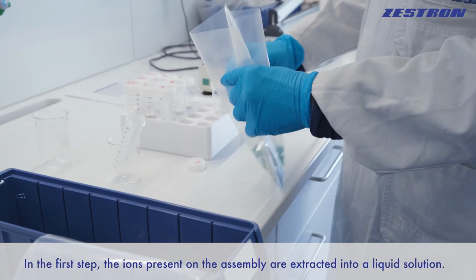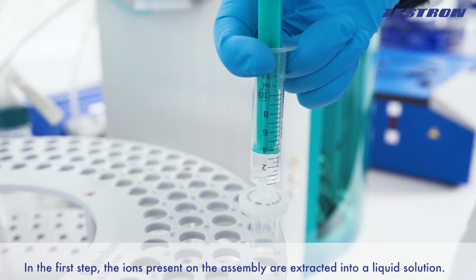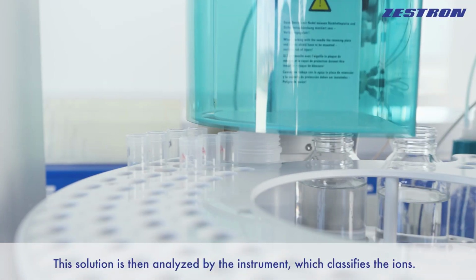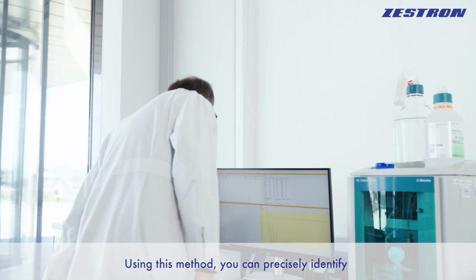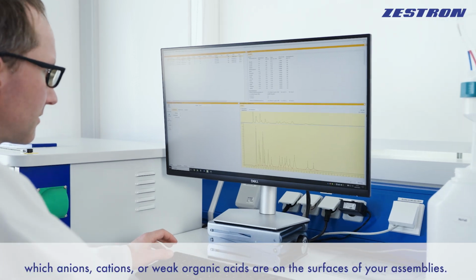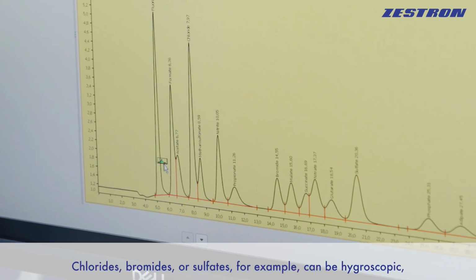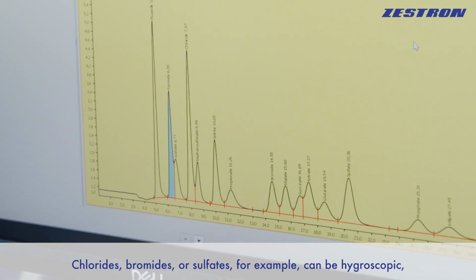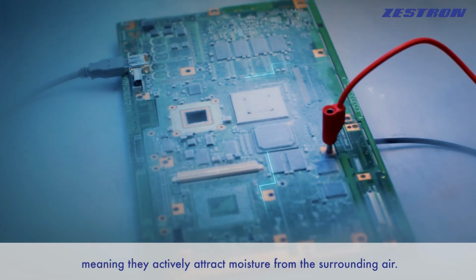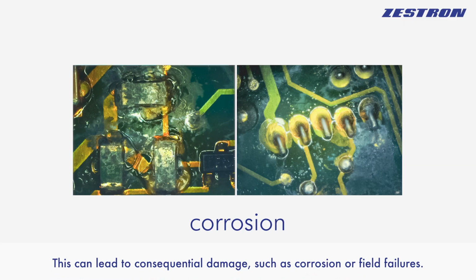In the first step, the ions present on the assembly are extracted into a liquid solution. This solution is then analyzed by the instrument, which classifies the ions. Using this method, you can precisely identify which anions, cations, or weak organic acids are on the surfaces of your assemblies. Chlorides, bromides, or sulfates, for example, can be hygroscopic, meaning they actively attract moisture from the surrounding air. This can lead to consequential damage, such as corrosion or field failures.